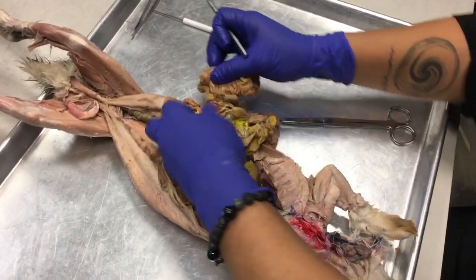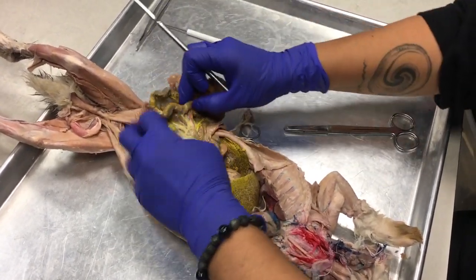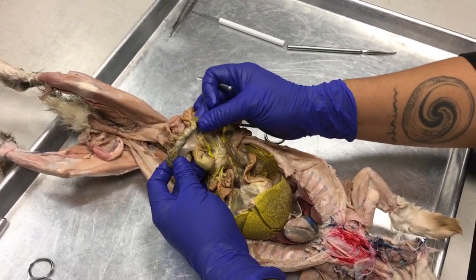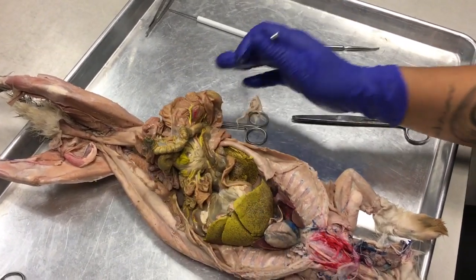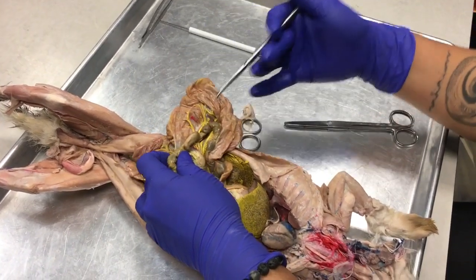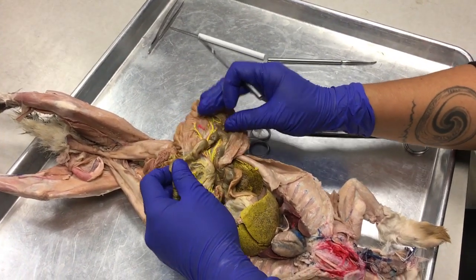Disgusting. I don't know where one ends and one begins. Okay, if you look, the color of your intestine will change. Not necessarily the size, because it seems as if the small intestine is hypertrophied in some areas for this bacterial digestion process to happen.